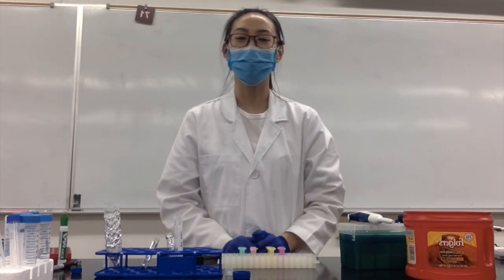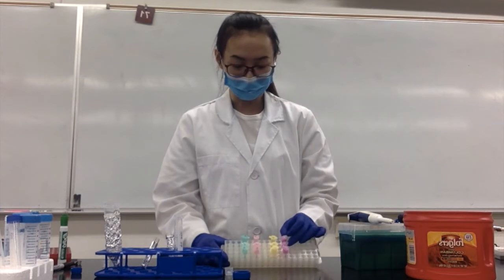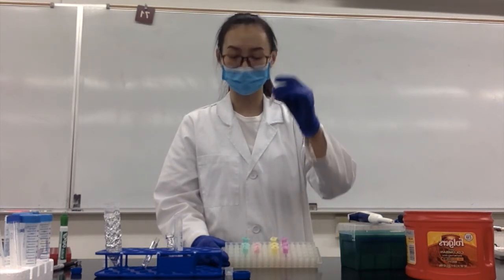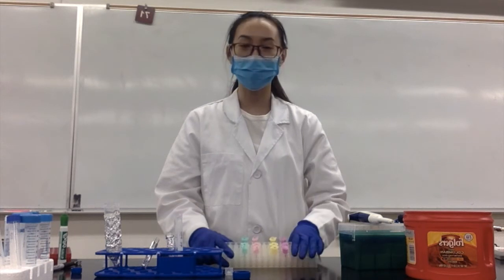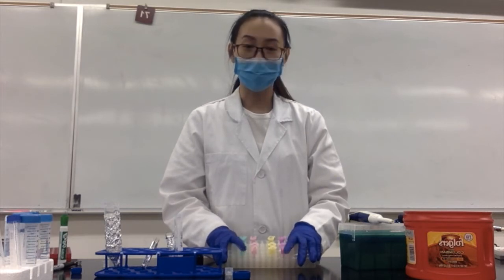Hello everyone, today I'm going to show you how to do our ROS measurement experiment. First, we need to find our cell samples. These are cell samples with treatment: we have the NTC, cells with 2% DMSO, cells with cisplatin, and cells with PT-DACO2. So we have four different groups, with three samples for each group.